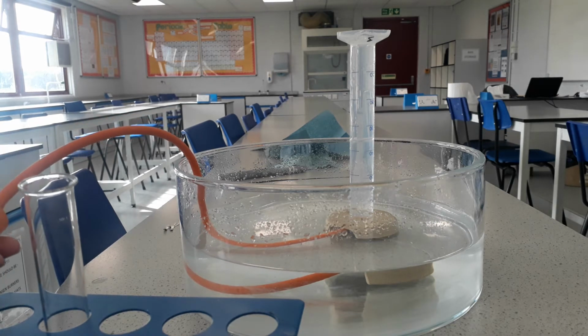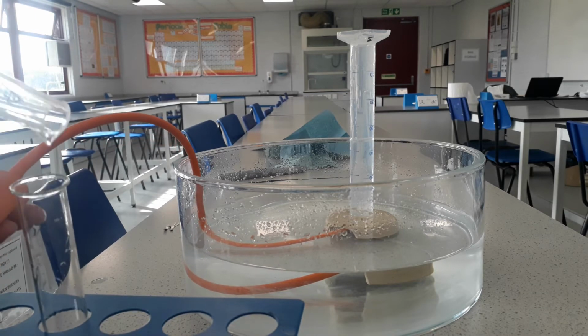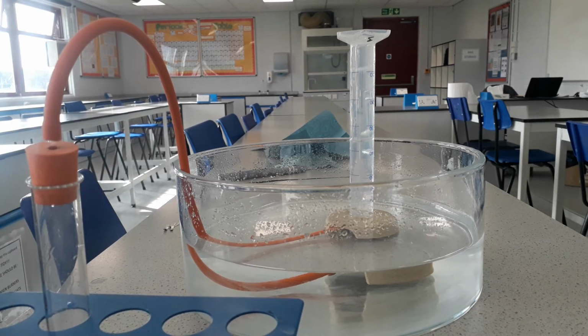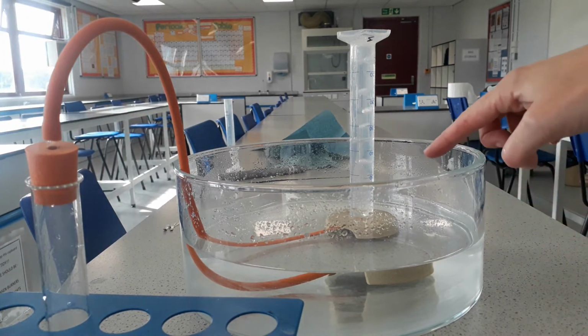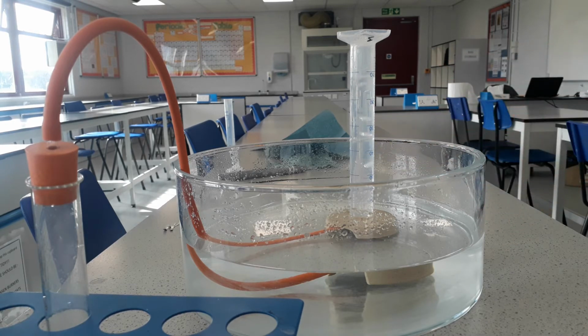We have a boiling tube which has got magnesium, and we're going to put some acid into it. And it then has a rubber bung with a delivery tube on it. This delivery tube goes to a trough filled with water, and it's on what's called a beehive shelf. This allows us to put the rubber tube neatly up into the measuring cylinder. And as you can see, the gas being produced travels down the delivery tube and into the measuring cylinder, displacing the water.